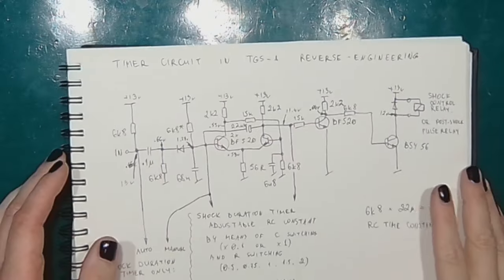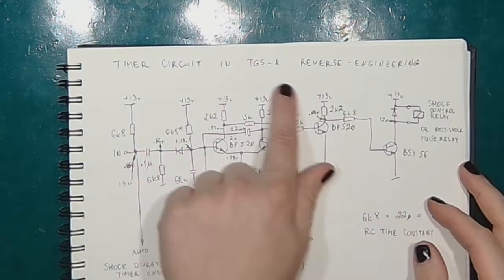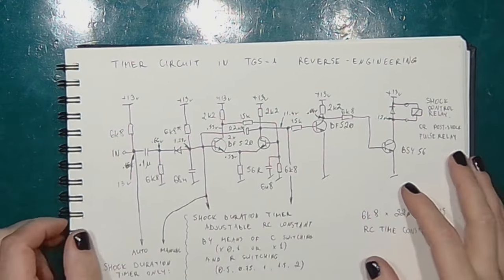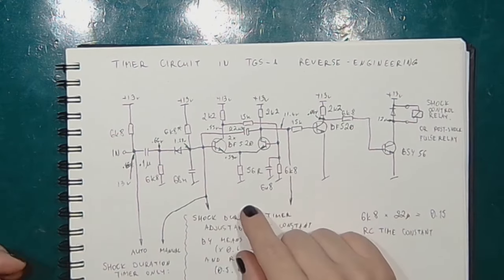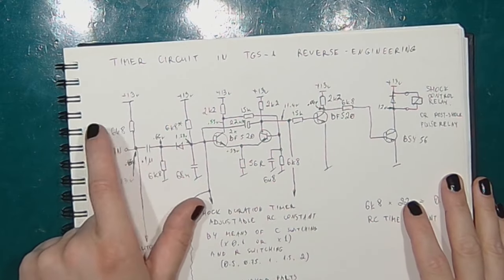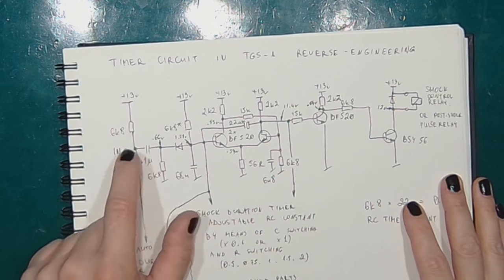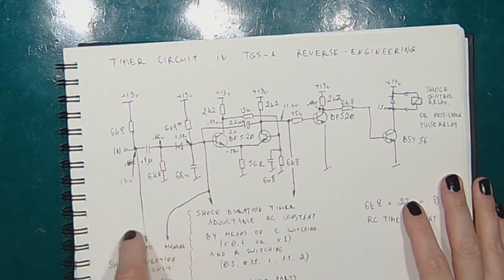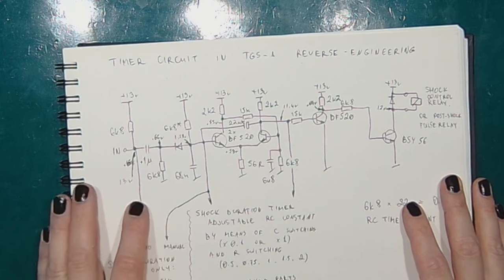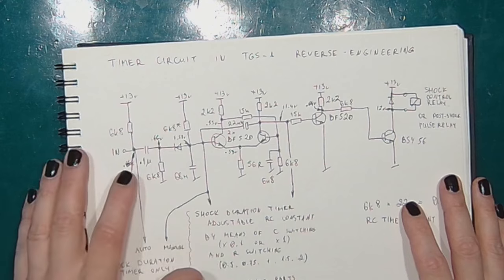So this is the timer and trigger circuit reverse engineered. We've got a capacitive coupling on the input that allows a pulse to go through when this is pulled down, but this capacitor will soon recharge.